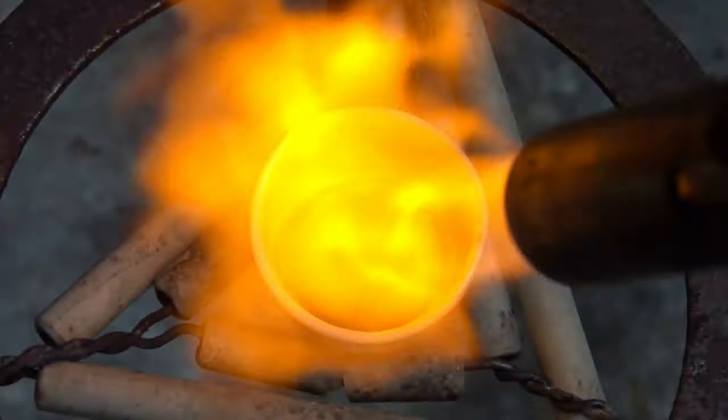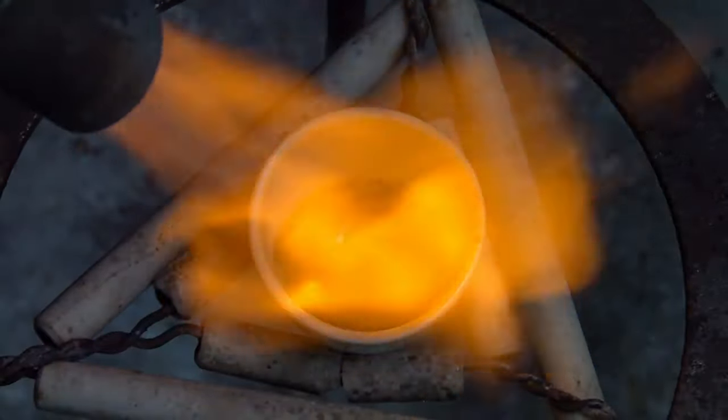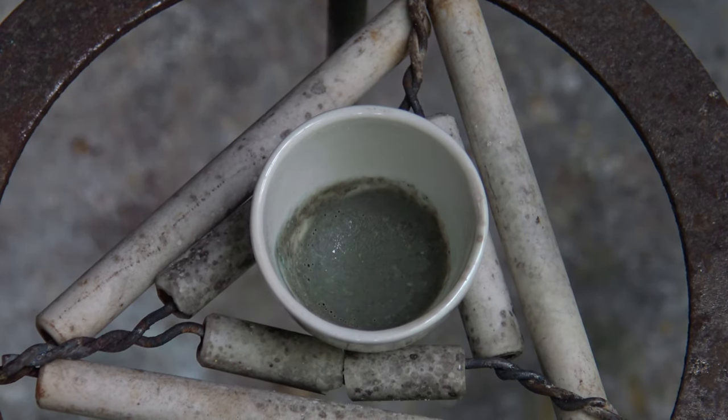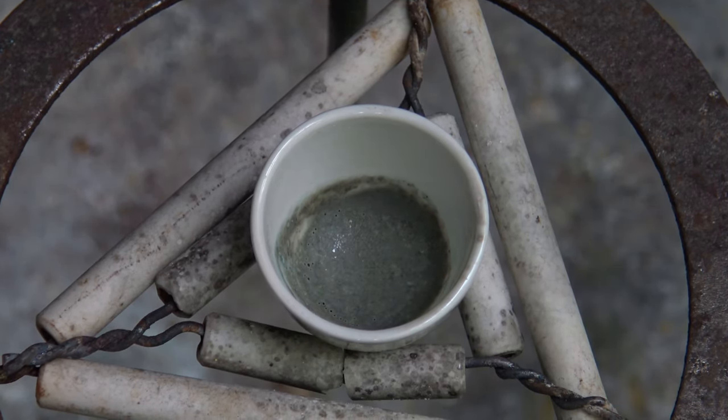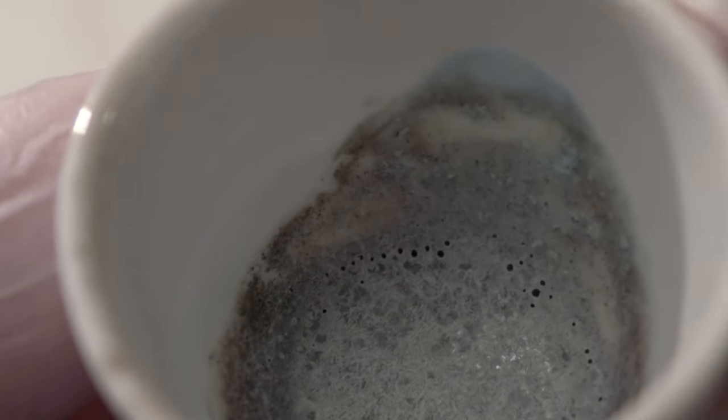Due to the low concentration of manganese, the color is only visible at some spots. Then, it was left to sit until it had cooled down. This often causes the color to turn blue-green.